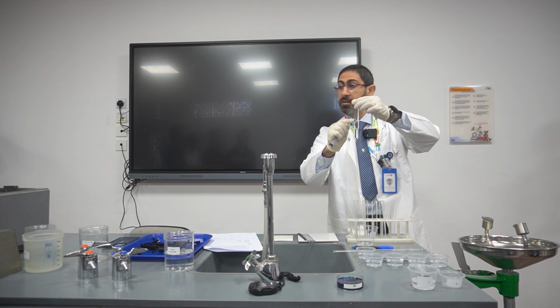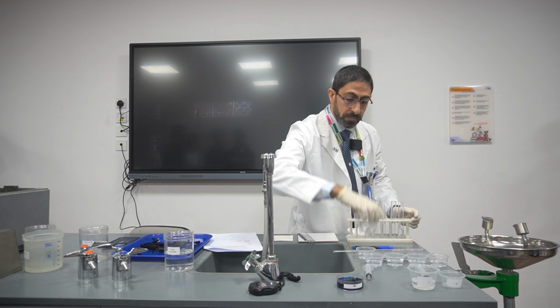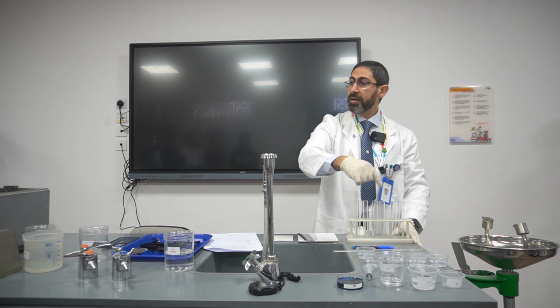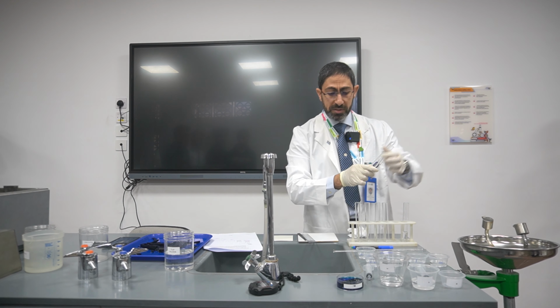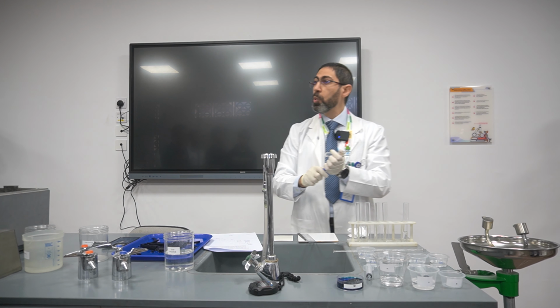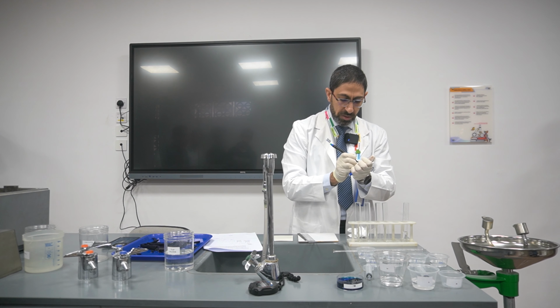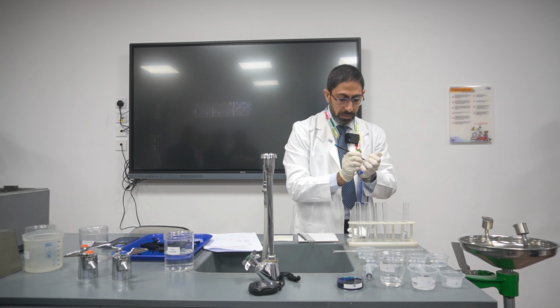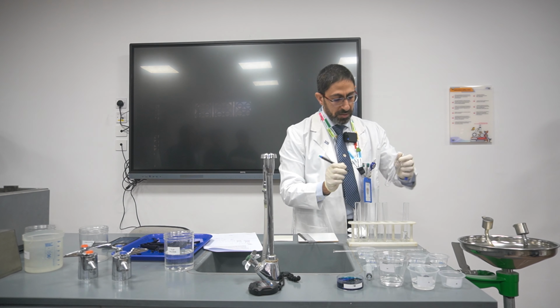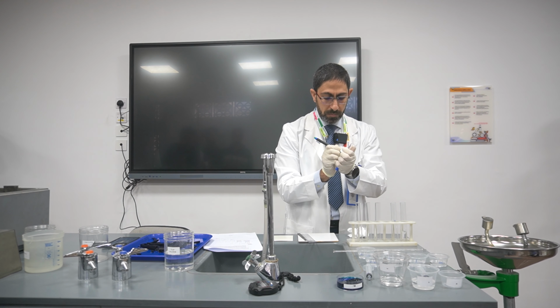and I label it with W. Now, before adding the sodium chloride different concentrated solutions, I would like to label them with their concentrations. So the first test tube will be 10, exactly, 10%. This is 10. Next will be 1.